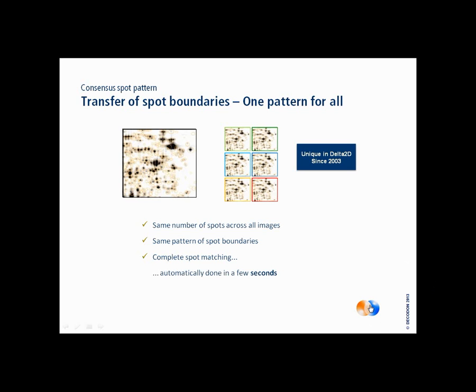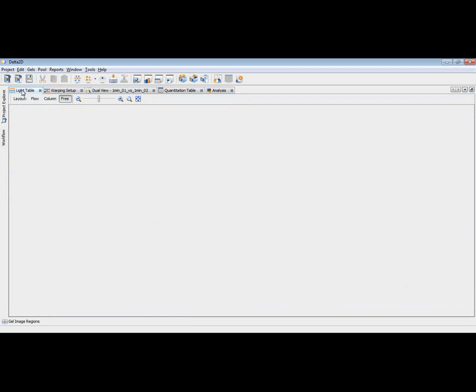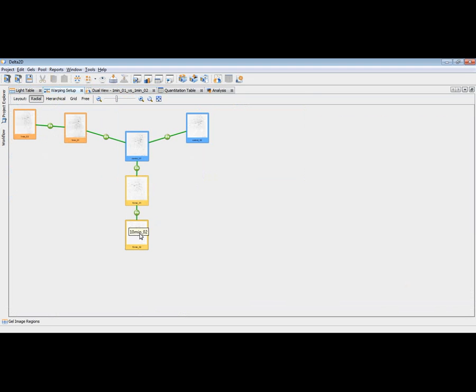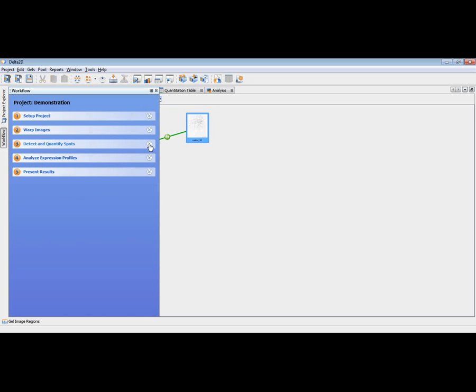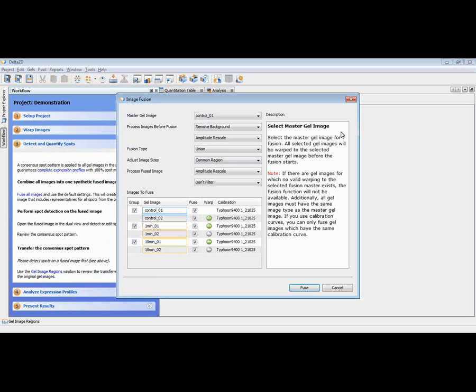Let me show this in Delta 2D. In Delta 2D, we have seen in the light table already that these images are grouped. We have warped them, and assuming that the warping is fine, we can now fuse them. Let me click on the fuse images button, or let's choose the workflow and switch to step 3, where we have access to the fuse all images feature, and this is now opening the dialog where we want to choose the images which we need to fuse.